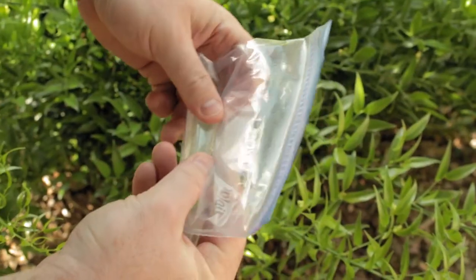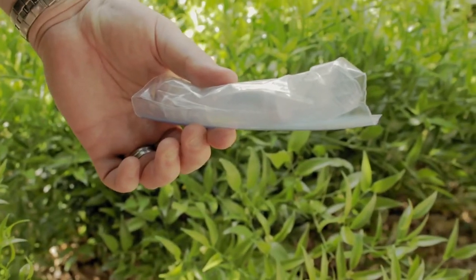The container should be double or triple bagged in plastic Ziploc bags. Following these instructions will ensure that you have the best samples submitted to the clinic for identification.